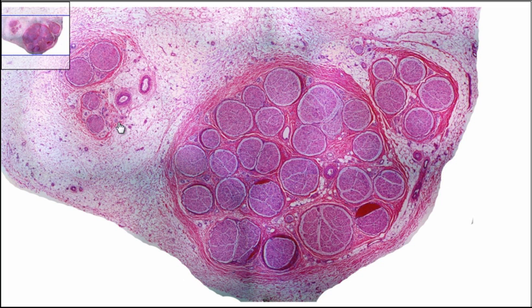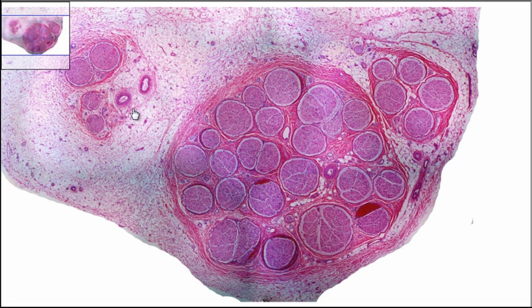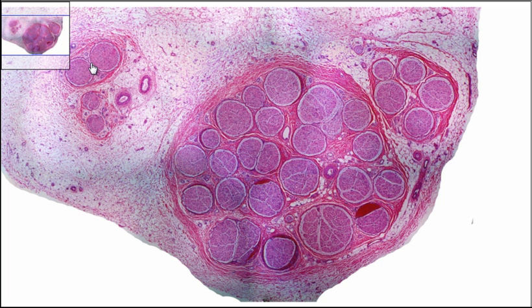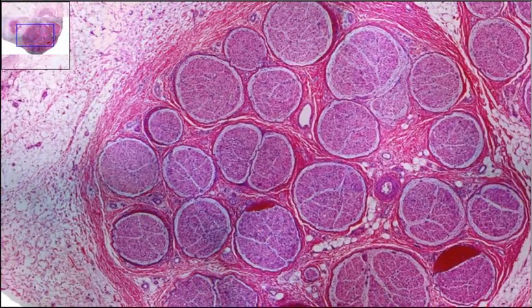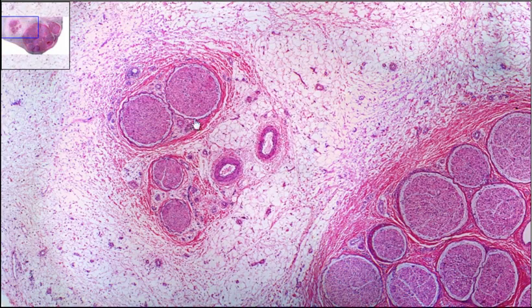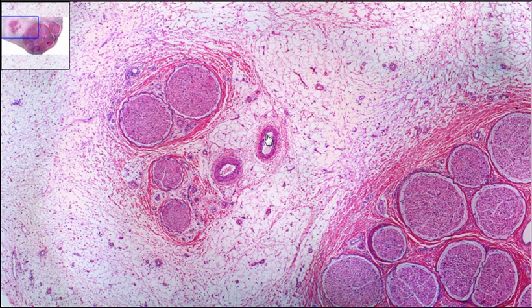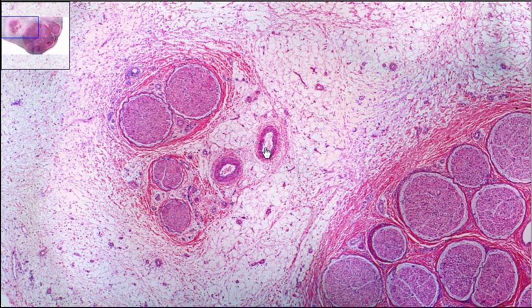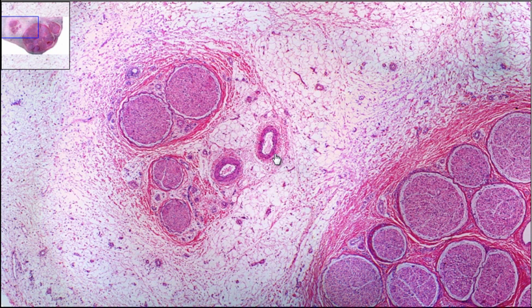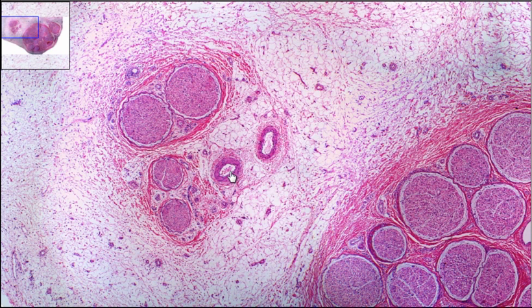On this one, same thing — outside we have the epineurium, and you have the individual perineurium around each fascicle. When we get a little closer, you can see that individual perineurium. Then you have these things — they're not filled in the center, they're empty. The reason being, those are not fascicles. Those are blood vessels.